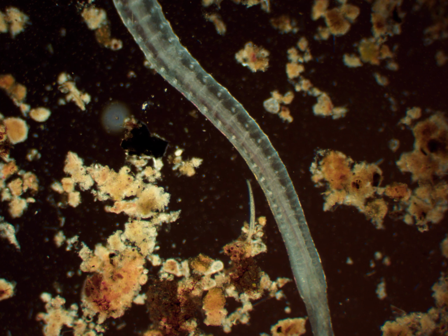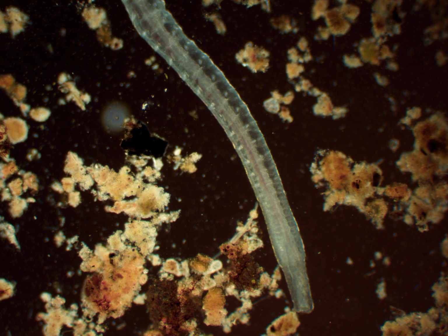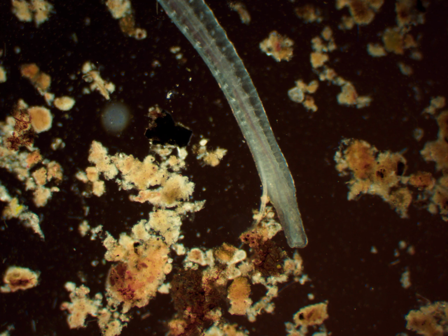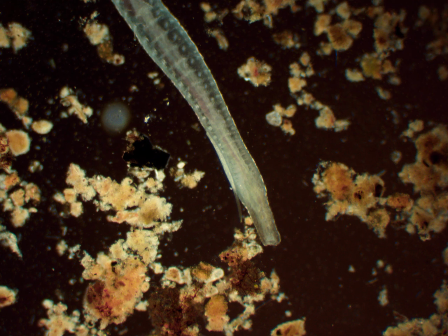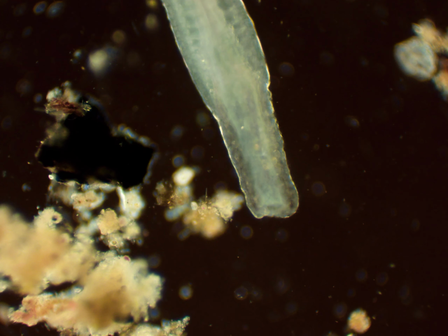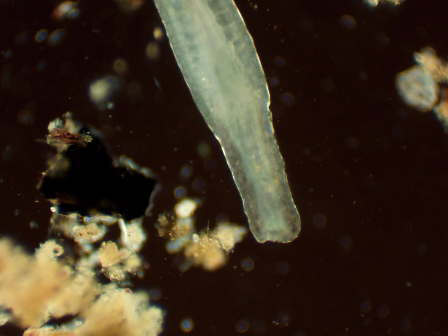That is how large this is compared to a spirostomum, since spirostomums are often compared to annelid worms because people think they look a lot like worms, but here is what a spirostomum actually looks like compared to an annelid worm. It is a lot smaller since it is a single-celled ciliate.